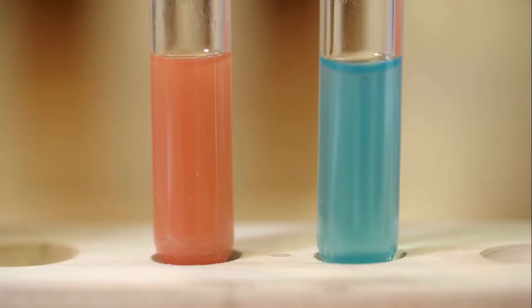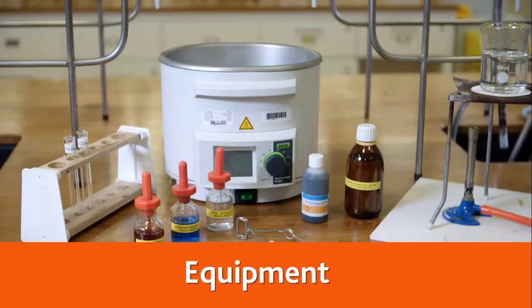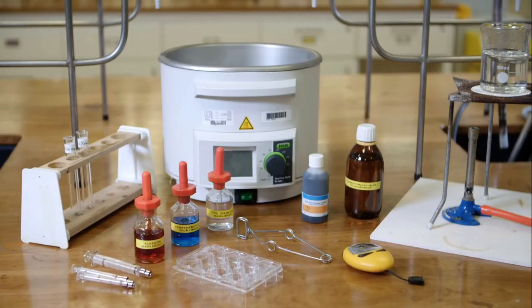A brick red coloured precipitate is observed in test tube 1. There is no change to test tube 2. The hydrochloric acid has hydrolysed the starch in test tube 1, producing simple sugars. The next experiment is the enzymatic hydrolysis of starch using amylase.